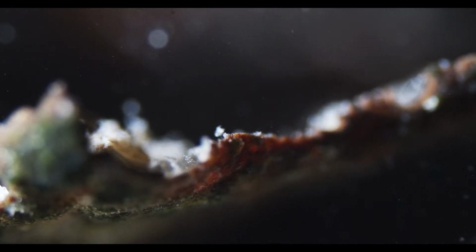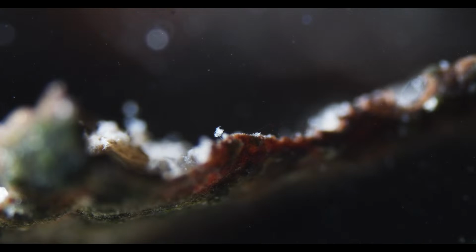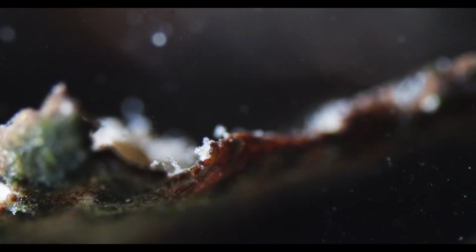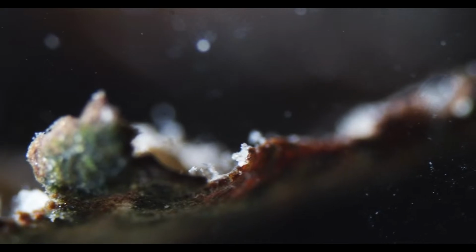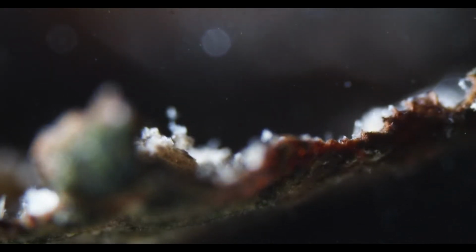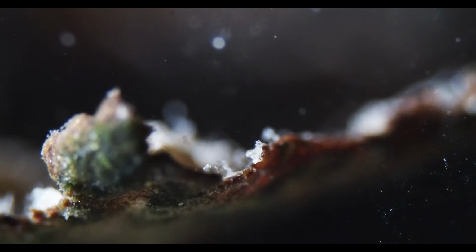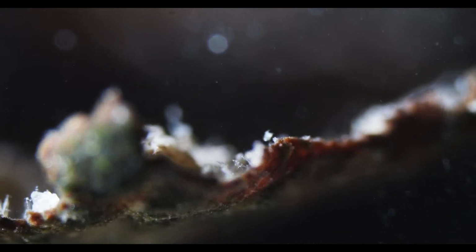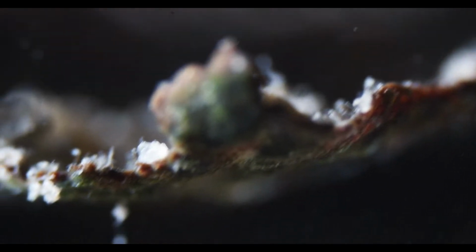Oh, so one of these guys, I think. They might be, I don't know, are they like flatworms? You know, the flatworms, they do some sexual reproduction too? No? A lot of them will reproduce sexually in fall, and the eggs might be hatching right now. Could be something like that. A tiny baby flatworm that can wiggle around. But the larvae are planktonic like that? I'm not sure.